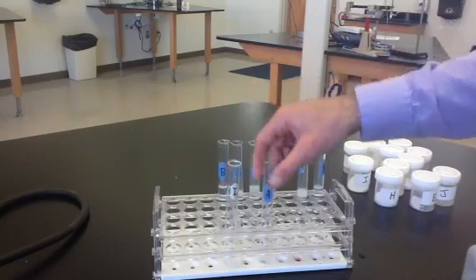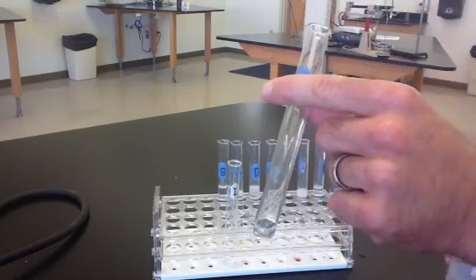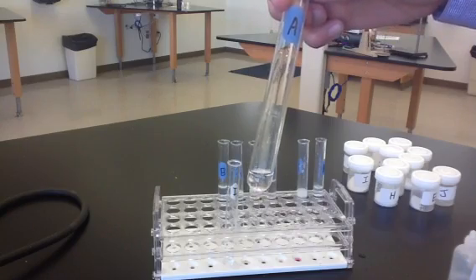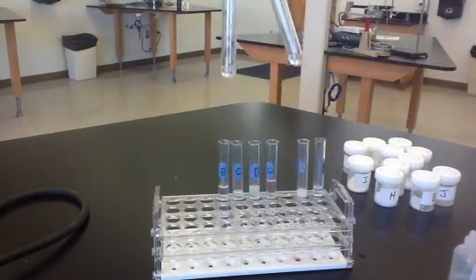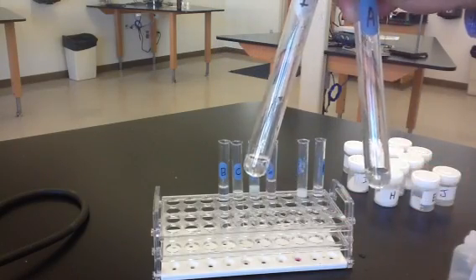And then we'll do the same test with A. So we'll add some vinegar to substance A. And when substance A is mixed with vinegar, we'll see that no reaction occurs. So substance I and A can be identified by the fact that I had bubbles being produced with vinegar and A had no reaction.